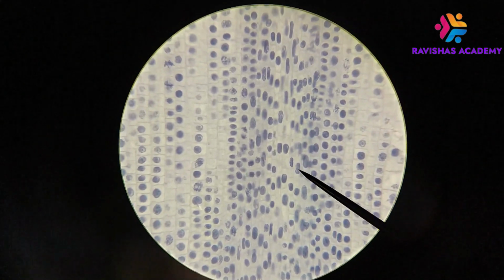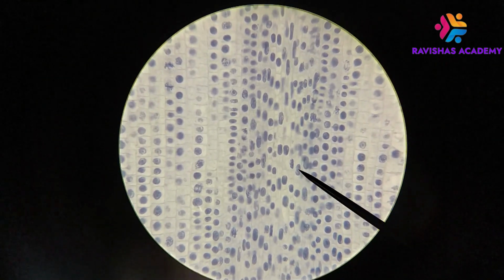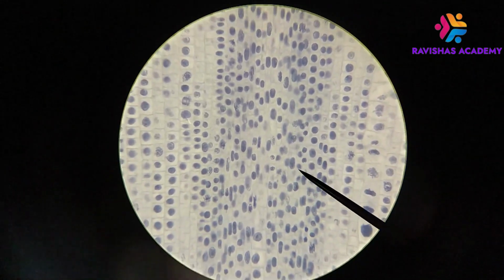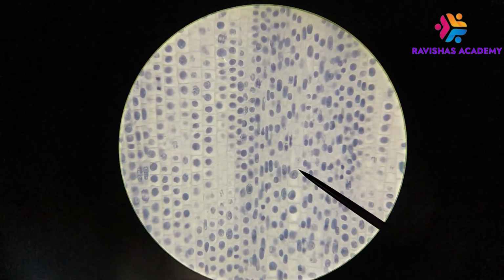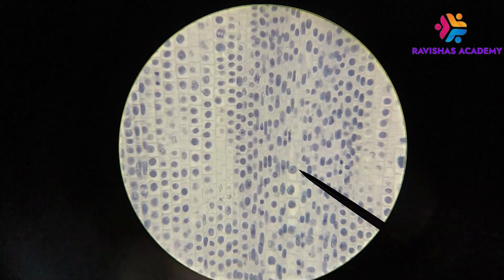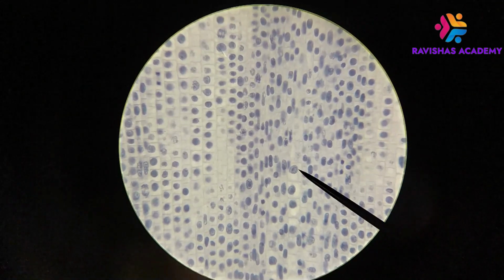They have a fairly evenly staining nucleus. There might be some slight differences in terms of the staining, but for the most part what you're seeing are nuclei that kind of have a very uniform staining to them. So here's another example, nice round nucleus in this case, and a relatively uniform even staining across the whole thing.